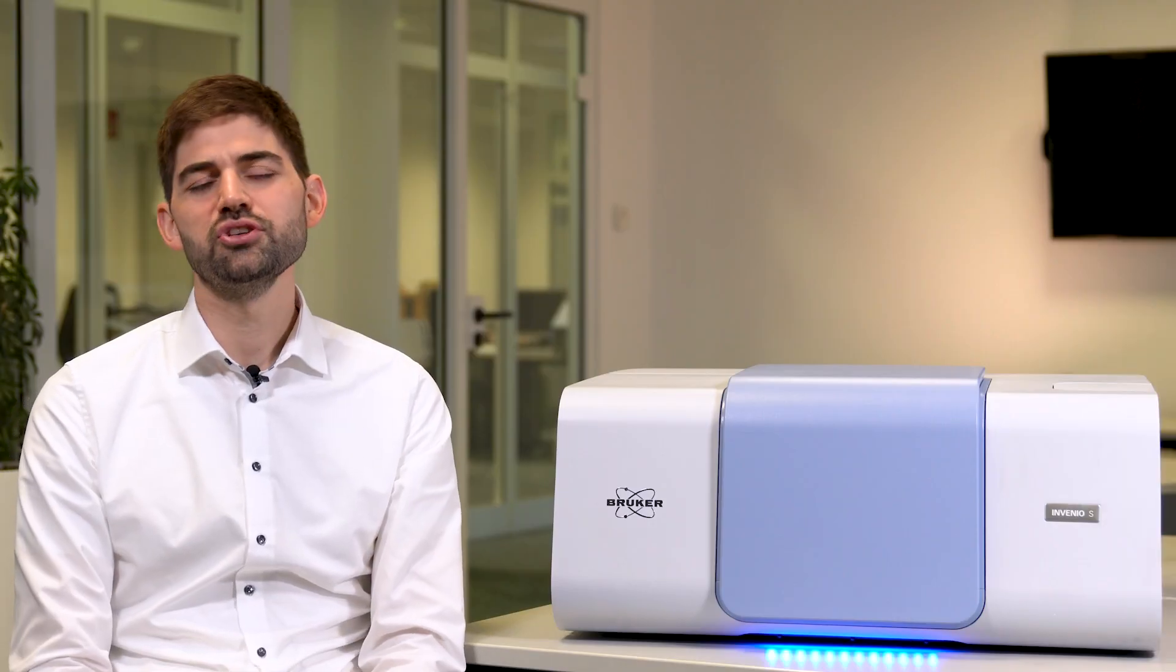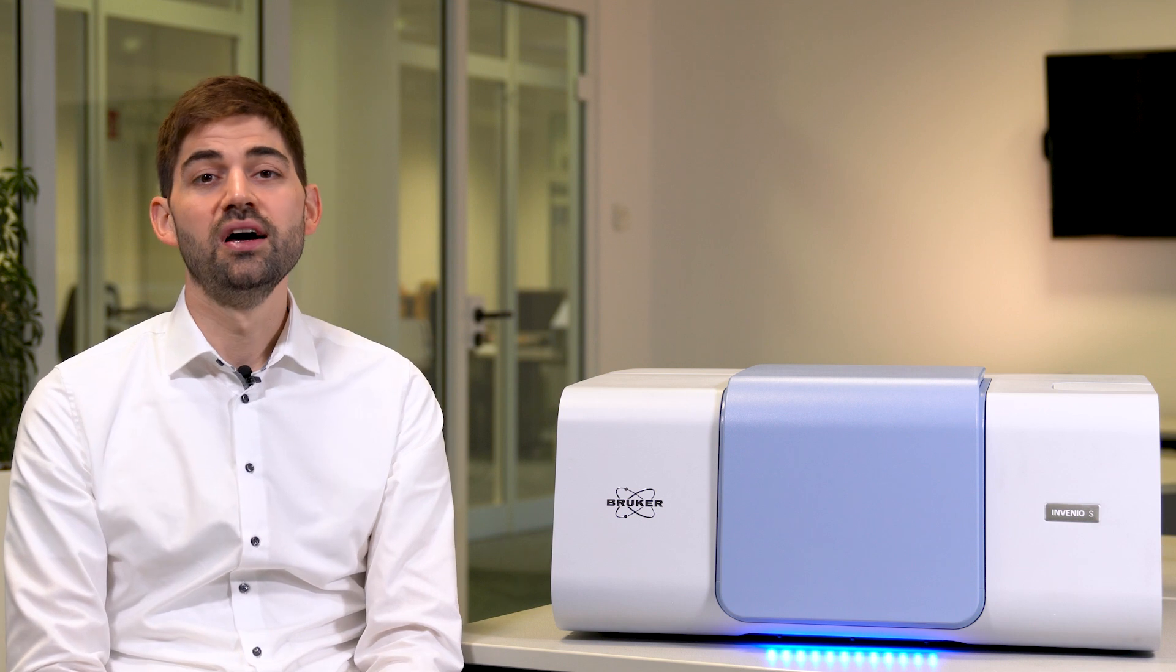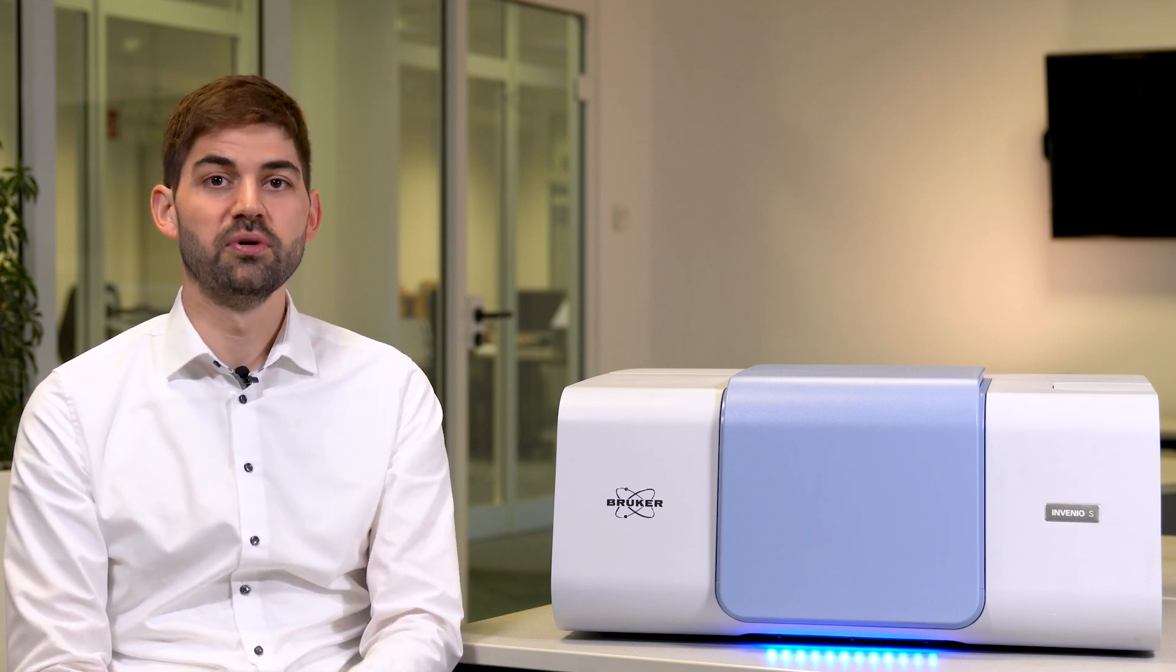At the end of the video, I will show you options how to increase the performance of the setup and also how to tailor it exactly to your requirements.